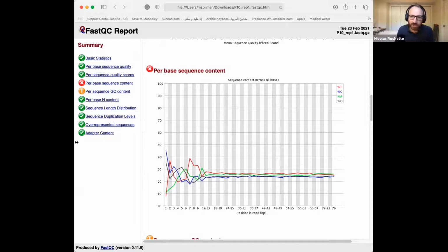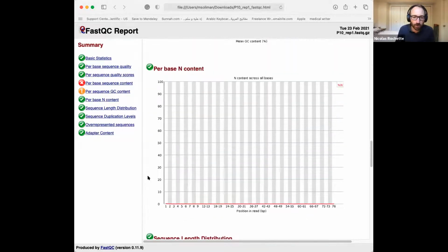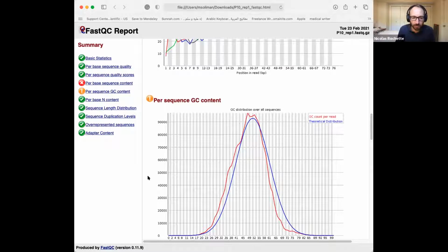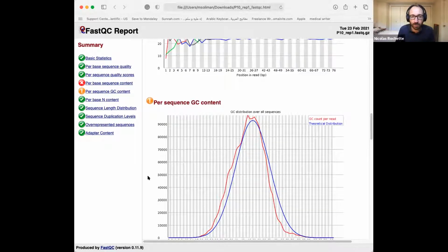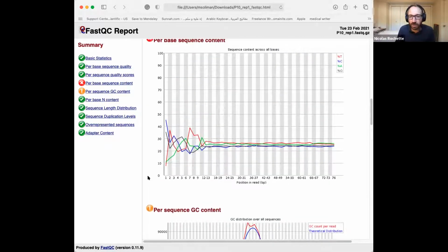Okay, so this one is interesting: the per base sequence content. The next two are actually paired, so there is the per base sequence content and the overall GC content right after that. Essentially what we see here, and that's what we're going to see for the Gaussian, so that's the GC content, in this case it's good. And then if we go back to the previous one, that's typical for RNA-seq experiments.